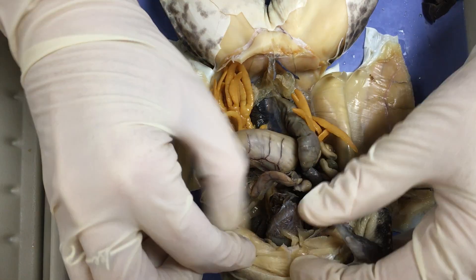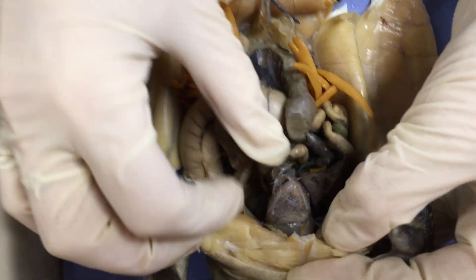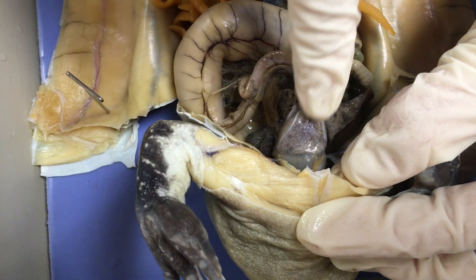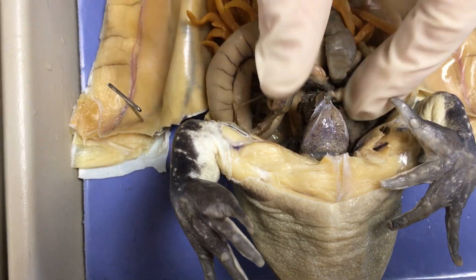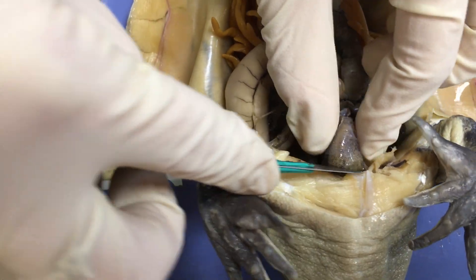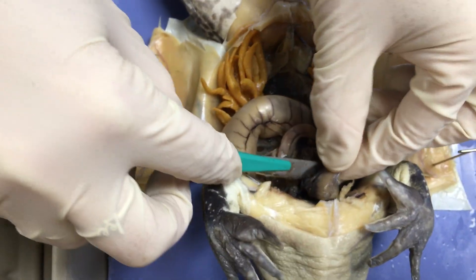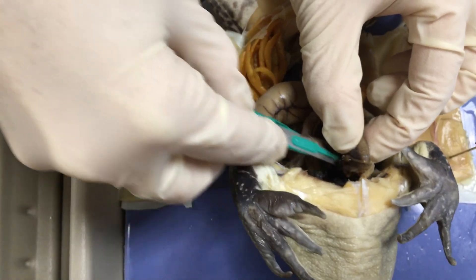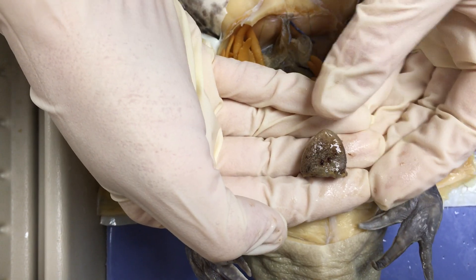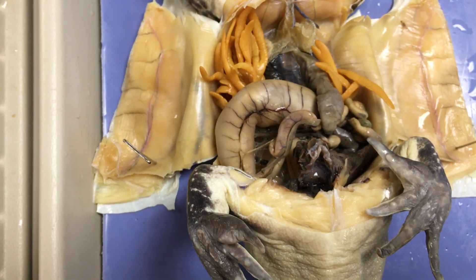Let's move to this structure right here on top. With a little bit of connective tissue around it, in your video it's going to look like an inverted triangle. This is their heart. Frogs have a three-chambered heart, unlike us — hence that triangular shape. They've got two atriums on the top, a right and left, and then a single ventricle in the middle below it. So again, it's a triangular-shaped organ.